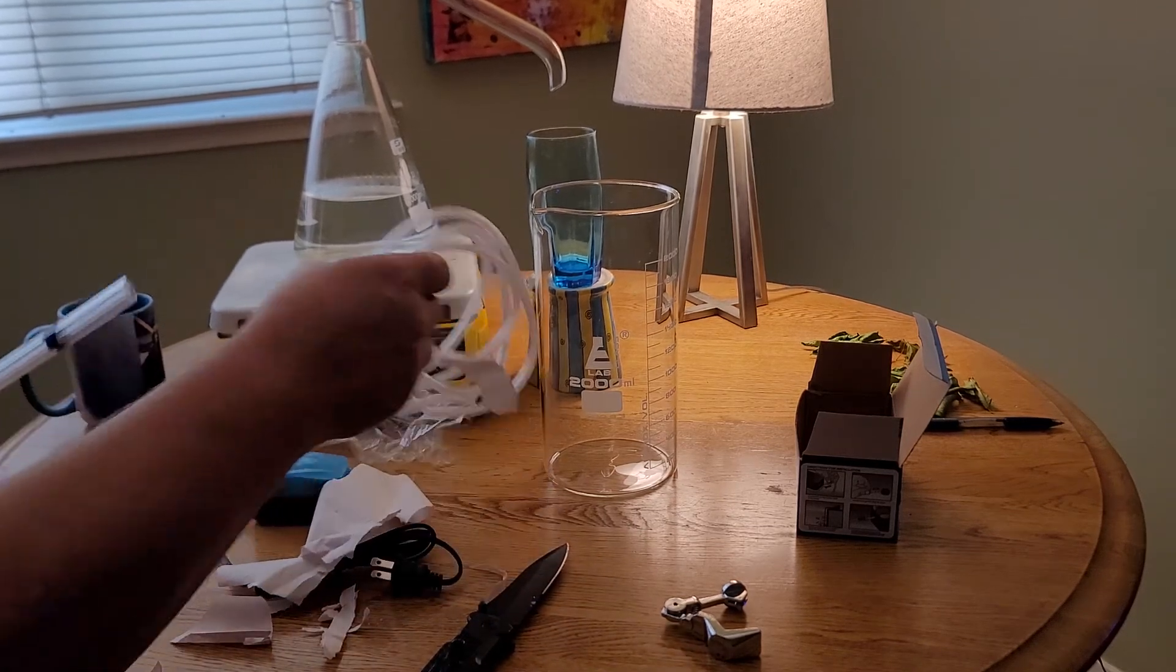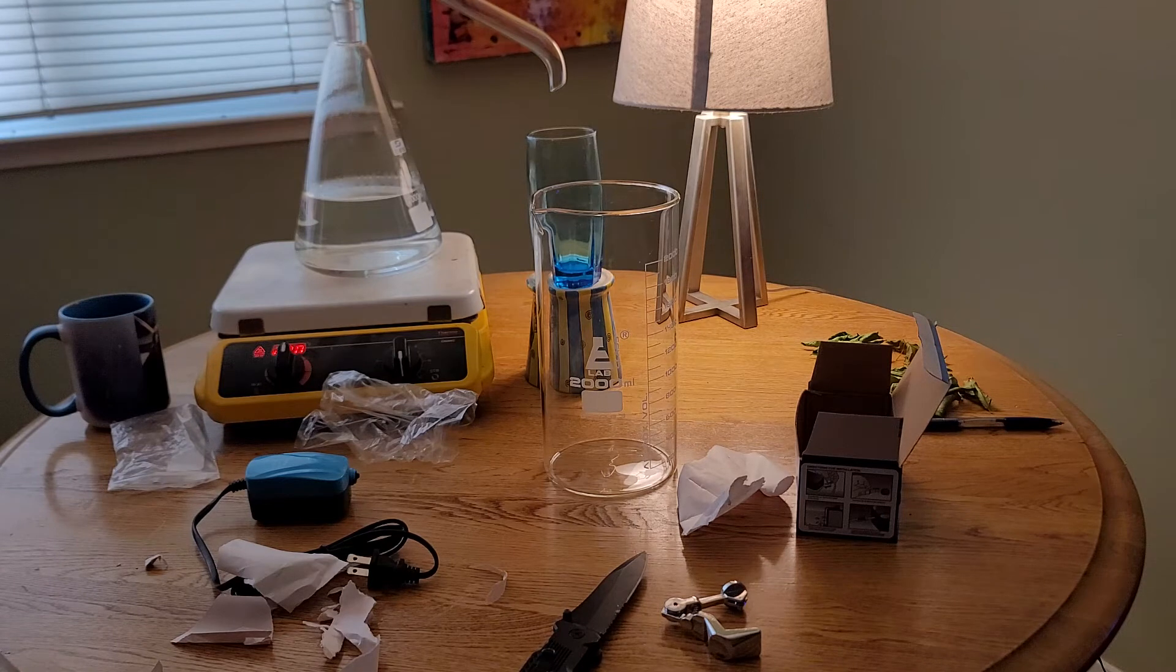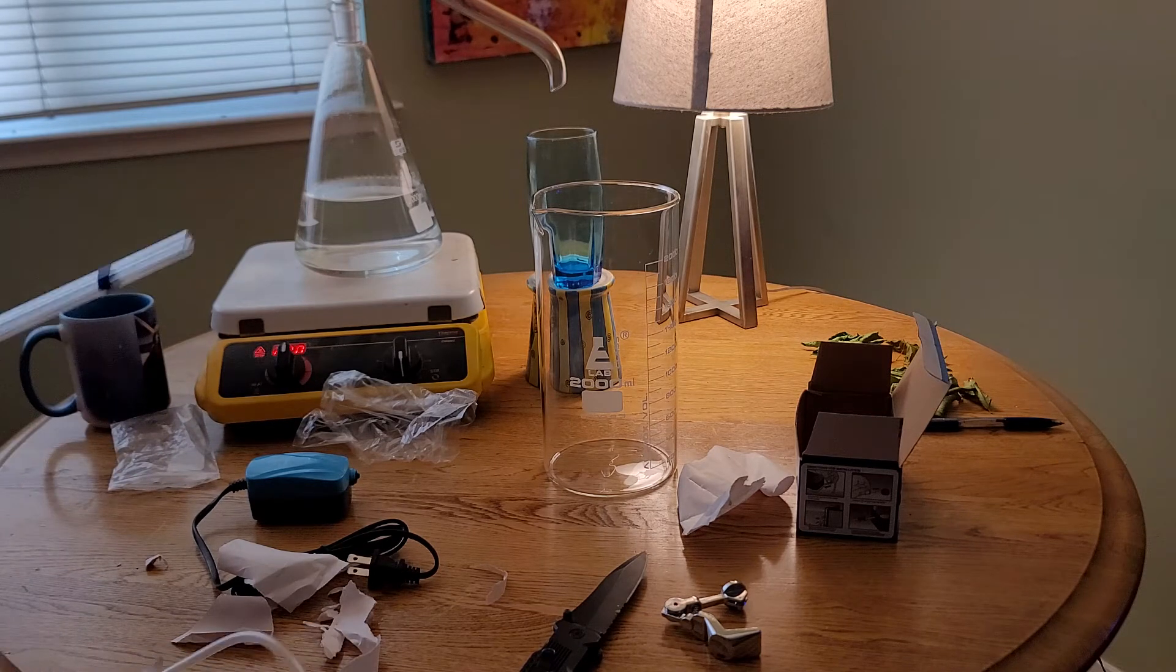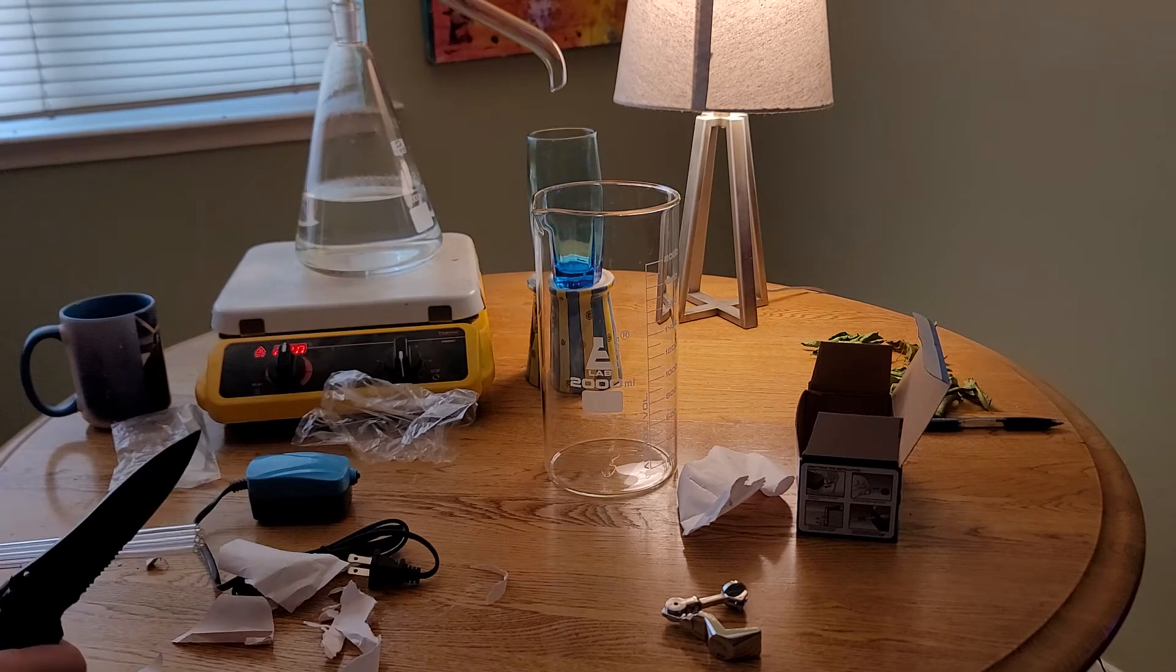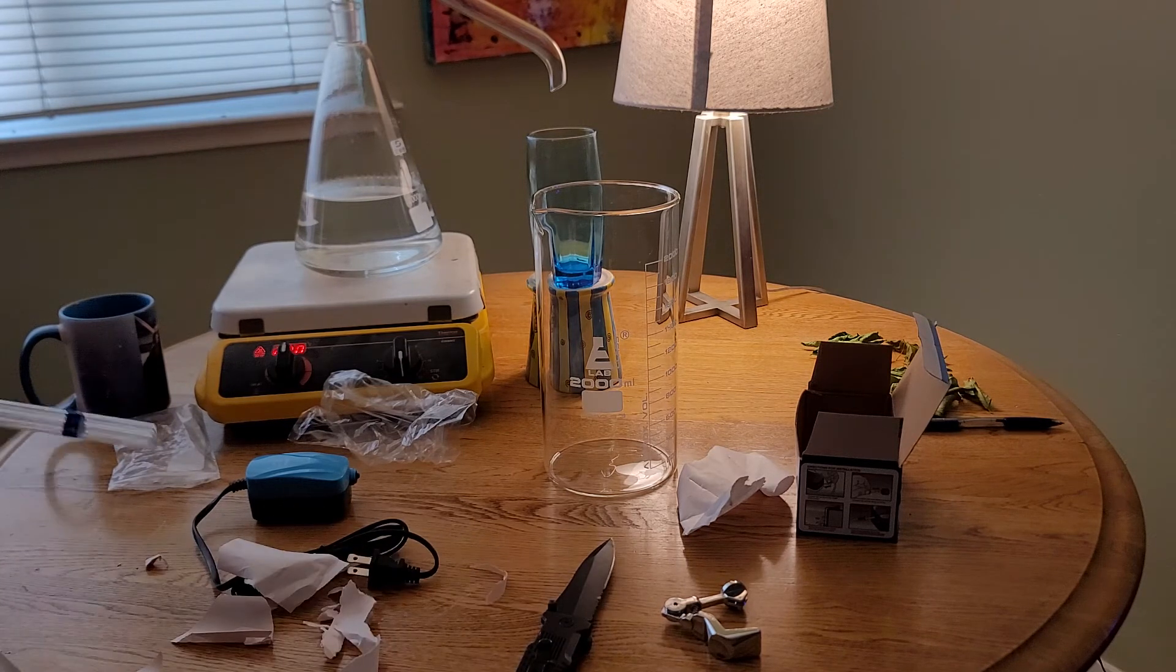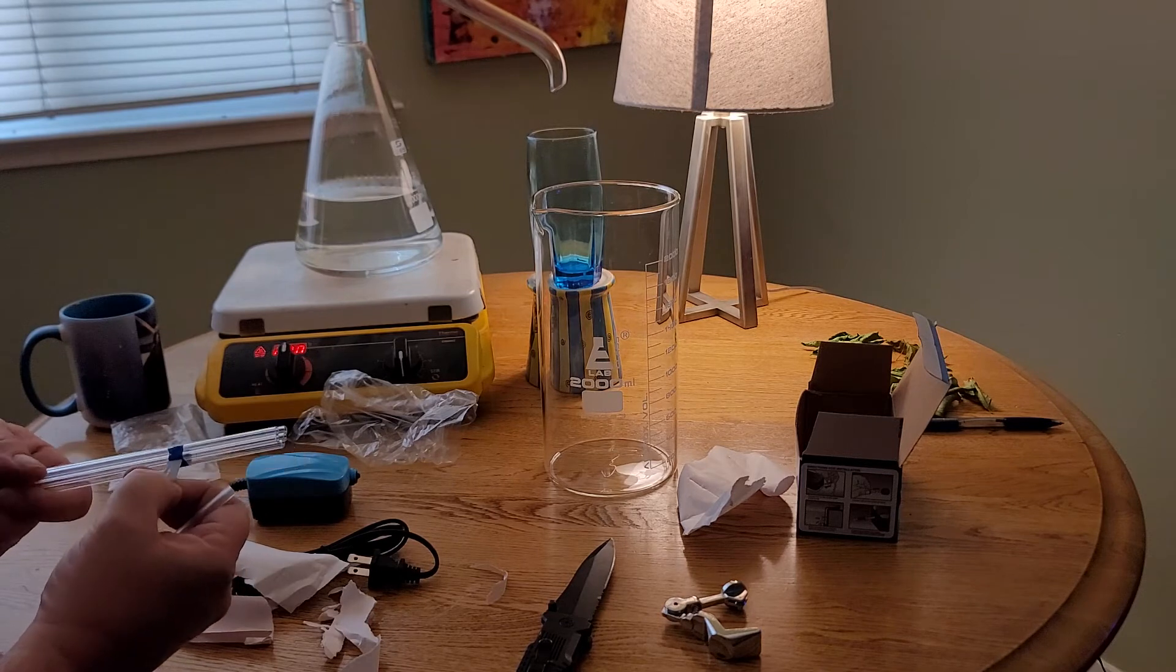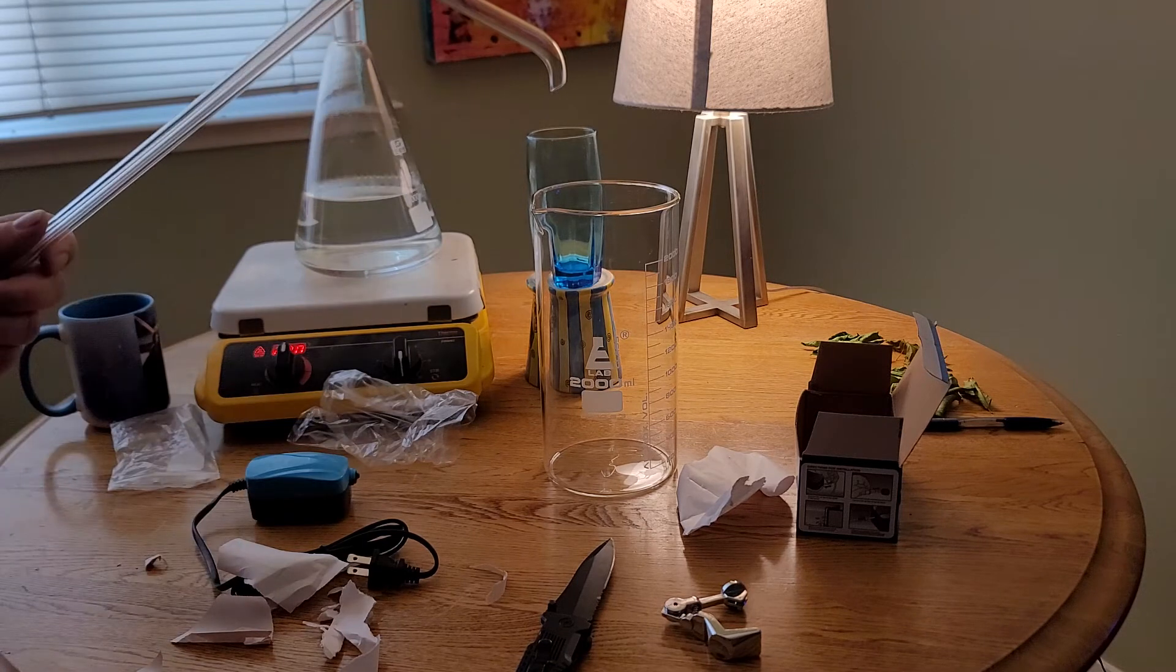So this plastic tube from the aquarium aerator, I should be able to fit on the end of one of these.